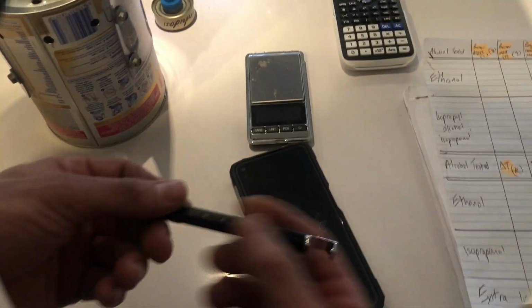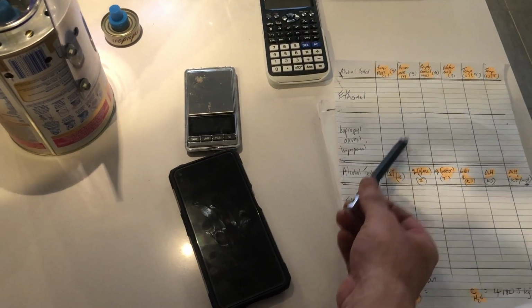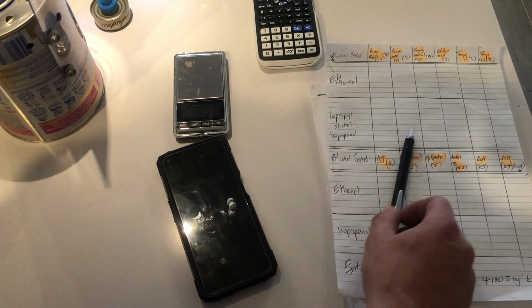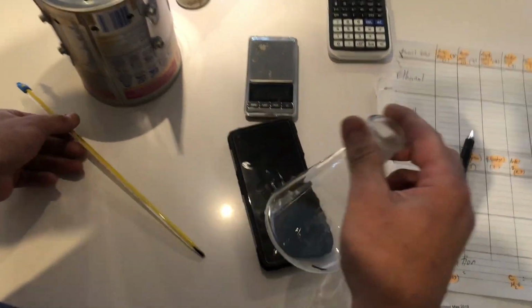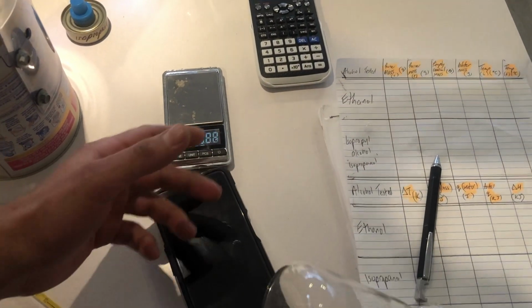Okay, let's start then. You're going to need to have that result table, and you perhaps will add the moles of the fuel as an additional column, as I suggested. We're going to get our conical flask, because that's what we've got available. It's 250 mL. We need to work out this mass, so we're going to tare a scale.